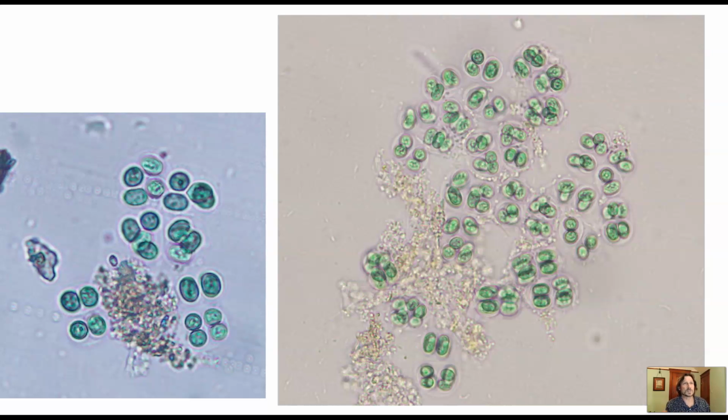When you open the iris diaphragm, you can't see anything but little green dots. You shut it all the way down, and that makes it dim, so you add a little bit more light. And then you can begin to see the capsule. So remember, when we're looking at very clear things, this is when we'll be playing with the iris diaphragm. If we were live in lab, it would take some time to go over that.